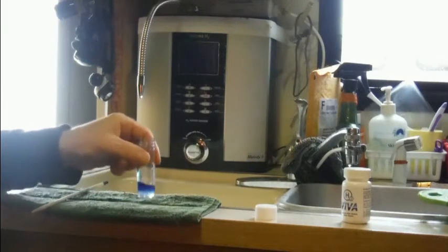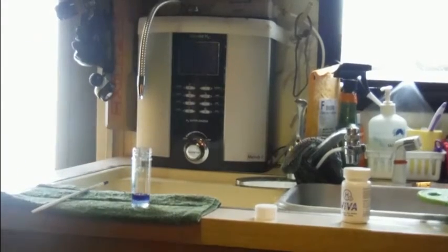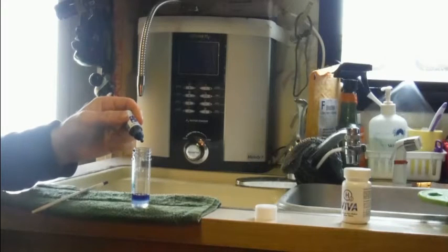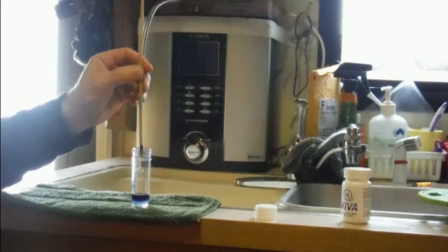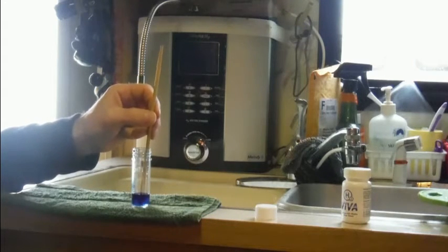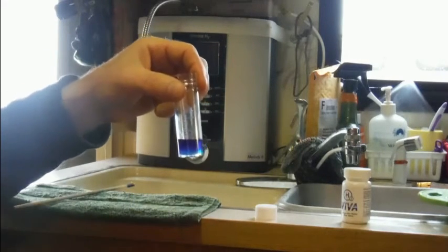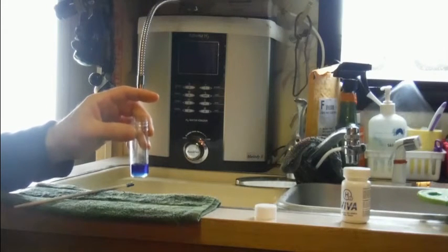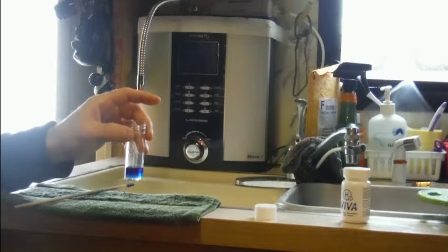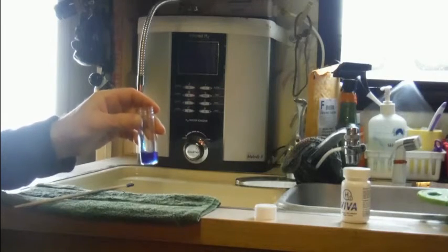You can see that on the bottom it still has not turned the water completely blue, so let me put a couple more drops in — so this is 11, 12 drops. I'll give it another stir. 12 drops, and you can see the water is completely blue now. So 12 drops times 0.1 parts per million per liter equals 1.2 parts per million per liter of molecular hydrogen dissolved in this water.